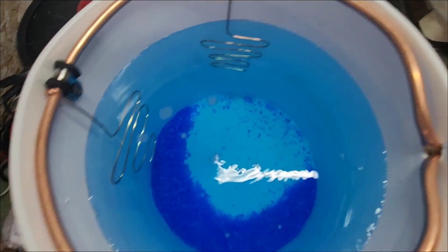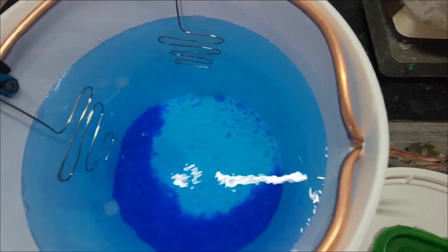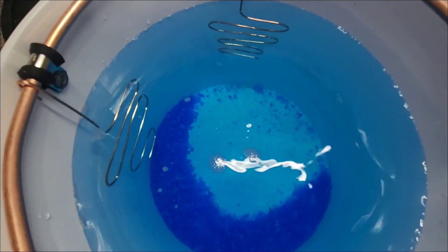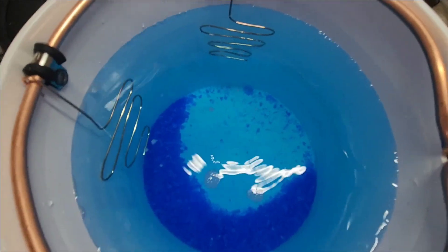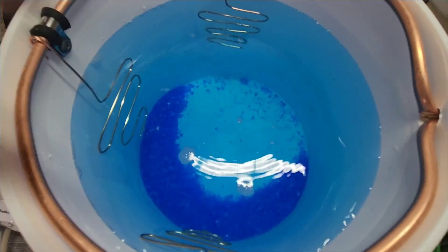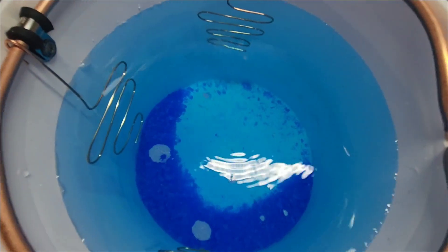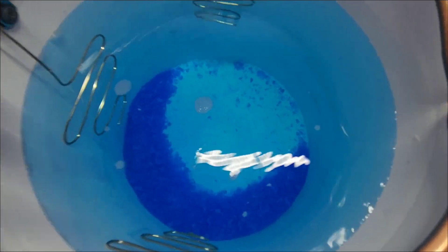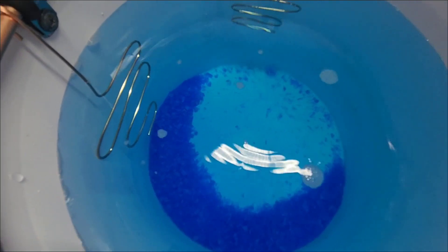We've got quite a bit of material to consume yet. If I wanted to expedite the absorption of that copper sulfate, I could have heated the distilled water up and then poured it in slowly, but it'll happen over time. I'll stir it occasionally just to make sure we can get it absorbed, and once we've got all those crystals absorbed I'll put some more in if it needs any more.